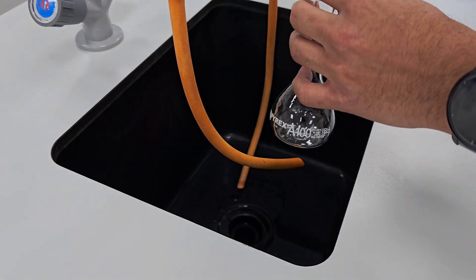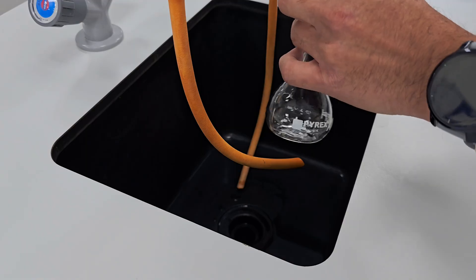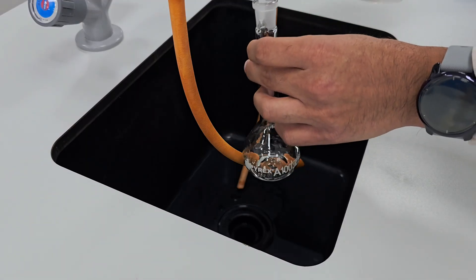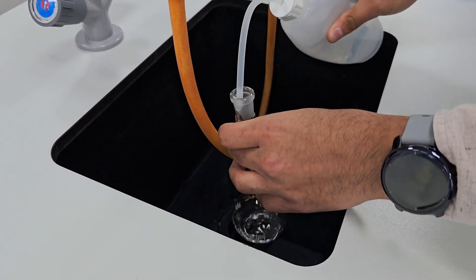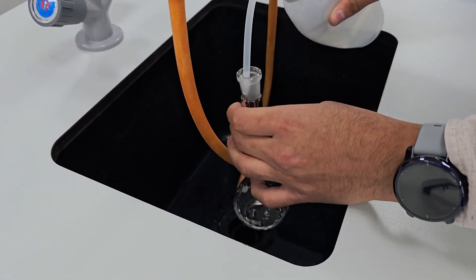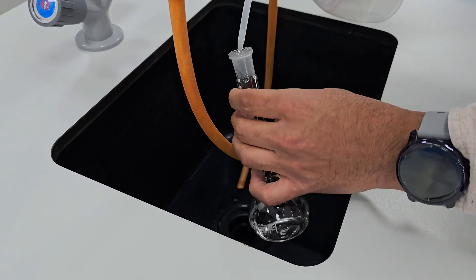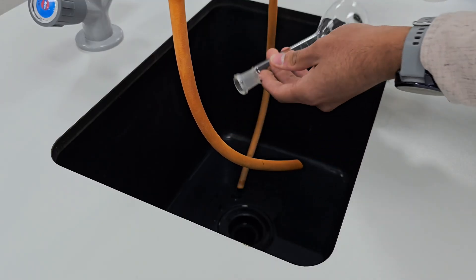Now I'm washing a 100 centimetre cubed volumetric flask and a funnel with distilled water to ensure they are clean. Any residue could affect the accuracy of the solution.